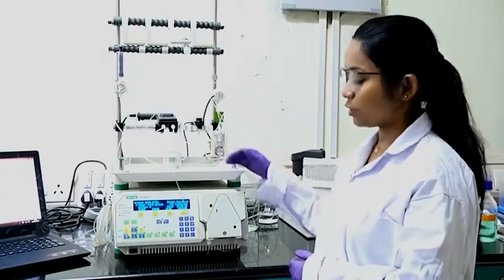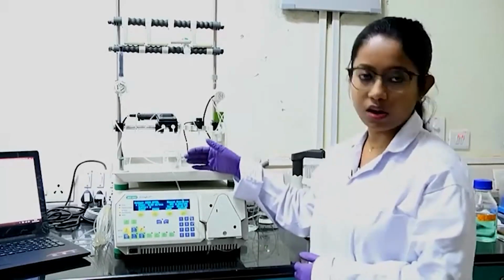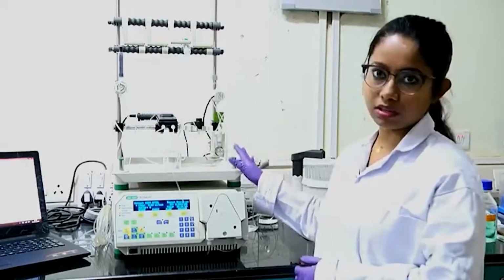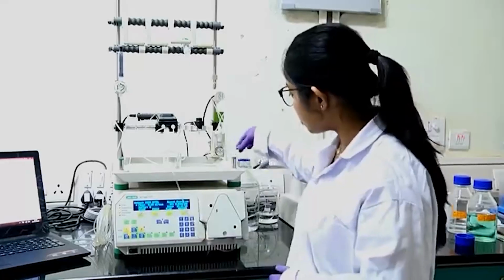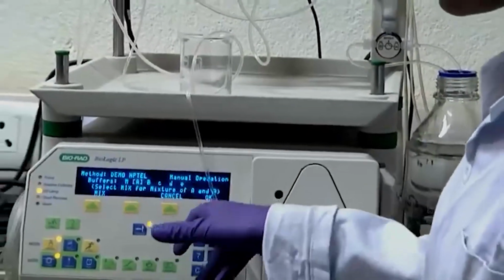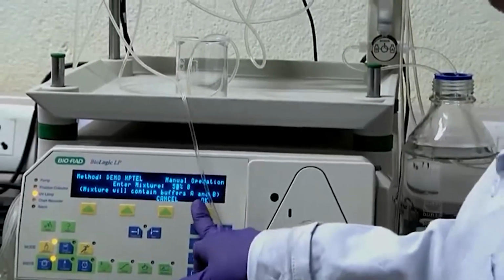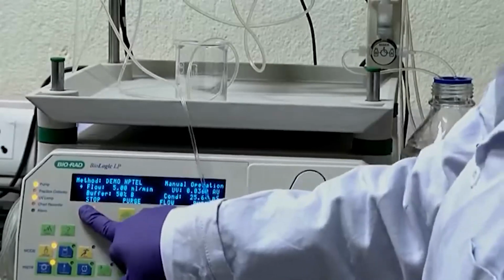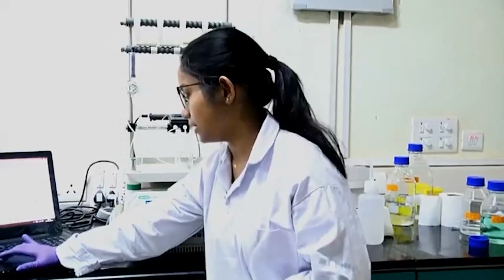So, basically it will remove all the salts, any kind of proteins that might be precipitated out in the channels, and it will clean up all your column and the tubes. So, now I have put both the inlets again in the deionized water, and I will make the buffer mix and take 50% of A and 50% of B, and again at the flow rate of 5 ml per minute I will start running only water and start recording here.